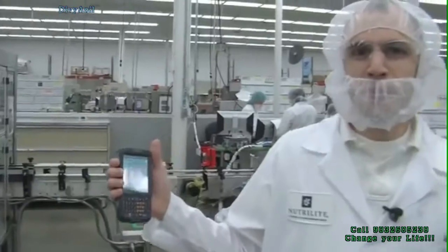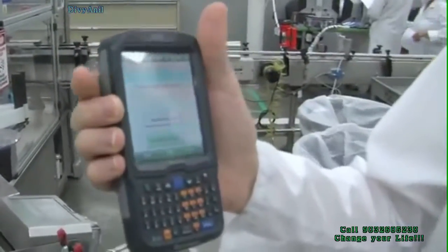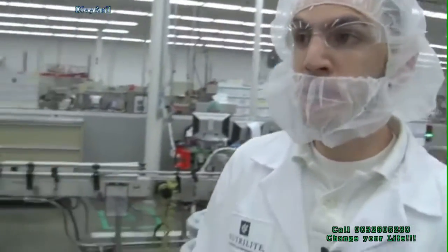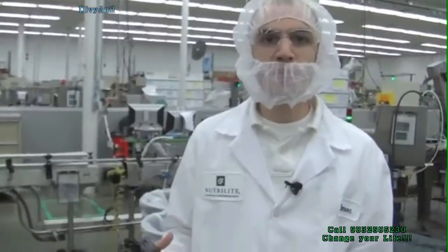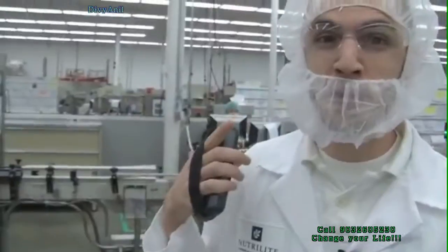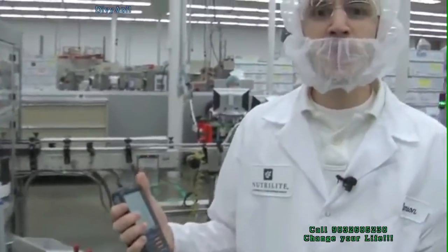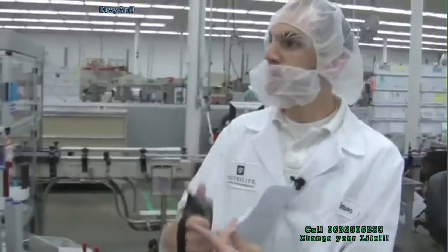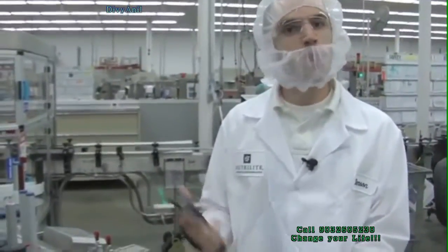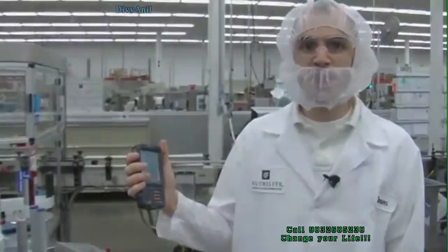This is our Mobile MES system. This has only been introduced to packaging so far — they have been our pilot program. Before this came along, the line leads would have to come in and put everything they observed on a piece of paper. If they didn't have a piece of paper, they would have to remember it and try to put it into the computer later on. With this, anything that happens on the line — whether it's a Visual Factory related thing, the line is down, or if they want to do tests — all of that can be done anywhere on the line, anywhere on the floor, as long as they have this in their hand.